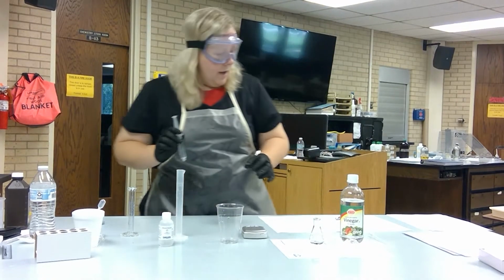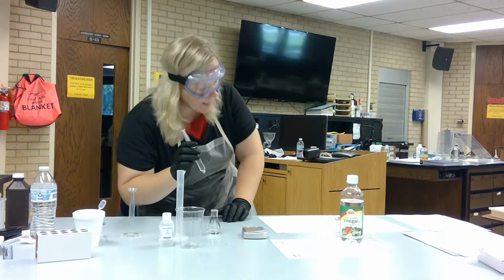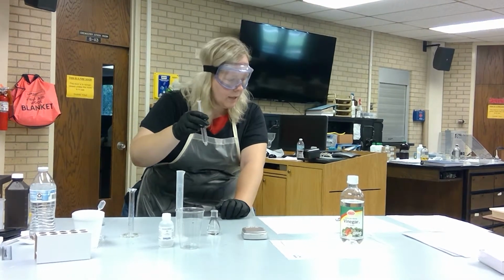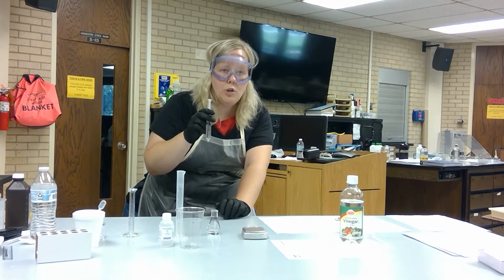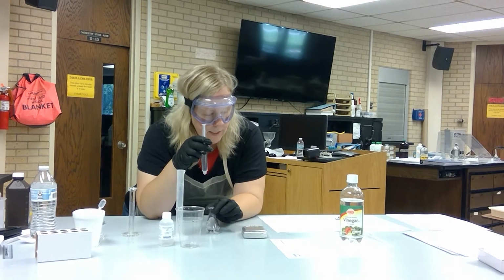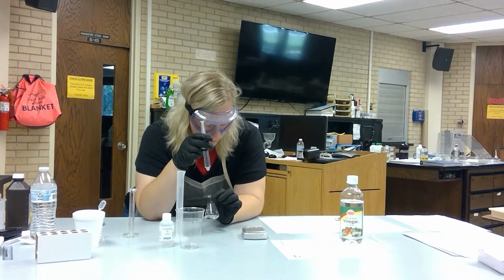All right, so now comes the part where we actually do the titration. If you look at step number 11, it says to add 0.5 milliliter increments. So I'm at 9 milliliters now. I need to end at 8.5. Then I'm going to end at 8, and I'm going to end at 7.5 and 7. You should not need all the complete 10 milliliters. But we're going to add sodium hydroxide in 0.5 milliliter increments until a single drop causes this color to change from clear to pink, and that persists for a few seconds.